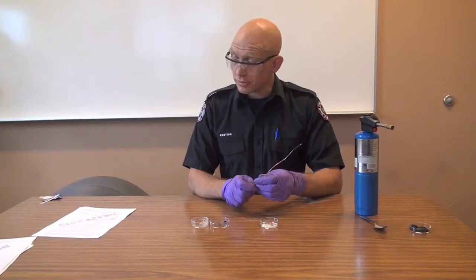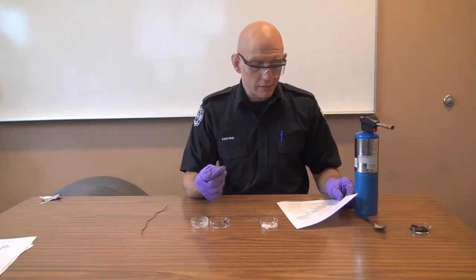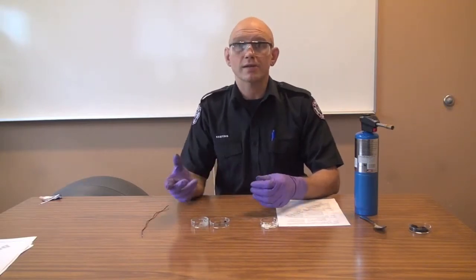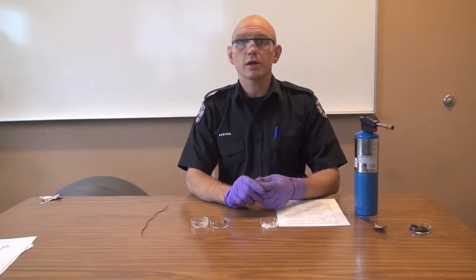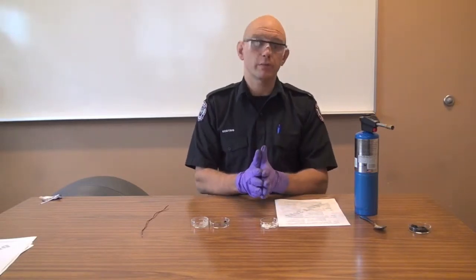Always do the oxidizer tests and the hot wire test first. And you also don't want to be pointing any of these tubes at somebody when you're doing it, because if it does pop out, you could have a flaming hot or burning piece of hazardous material go flying at your buddy.